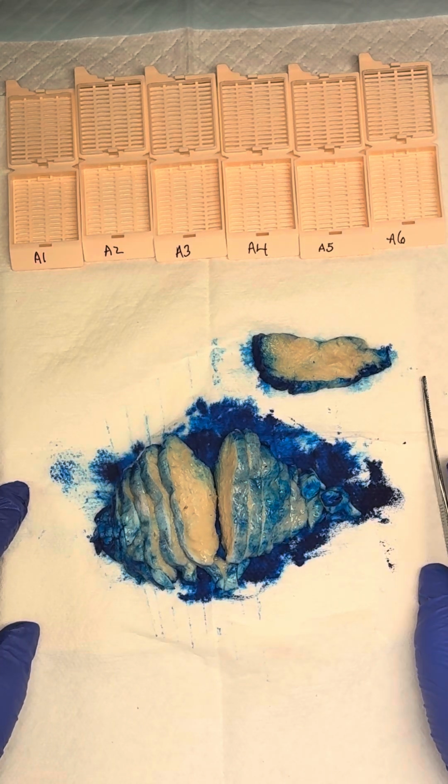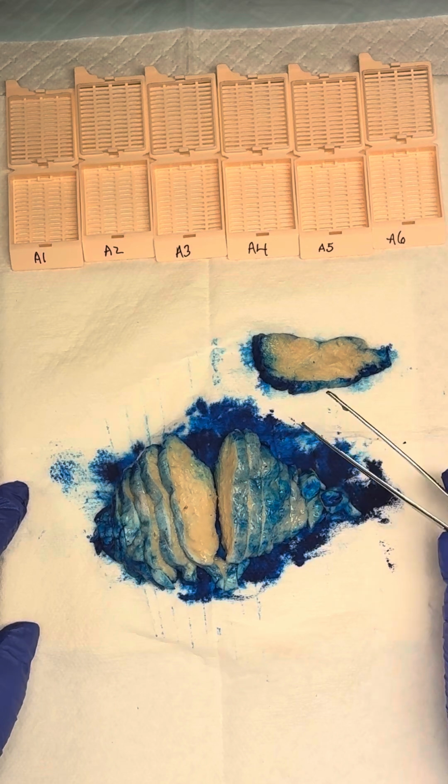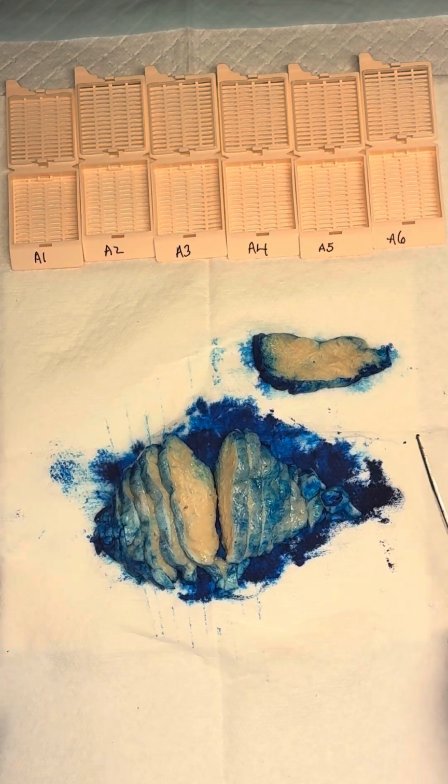So we've given our measurement. Now we can describe. In our thymomas, we would want to make sure we include if there are those fibrous bands, because those are indicative of thymomas. We can give our relationships to any other structures from the mass.